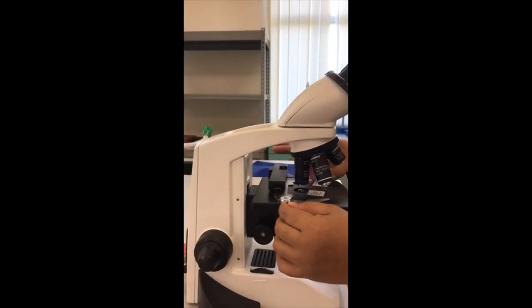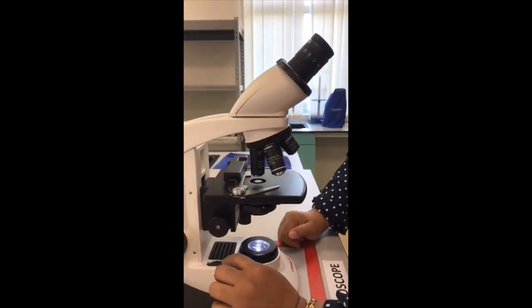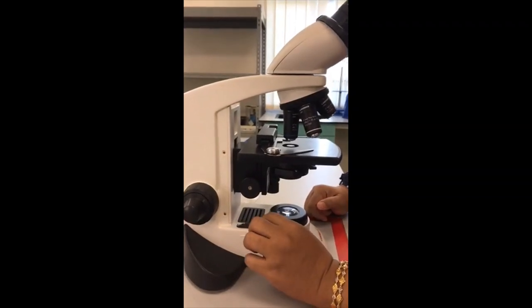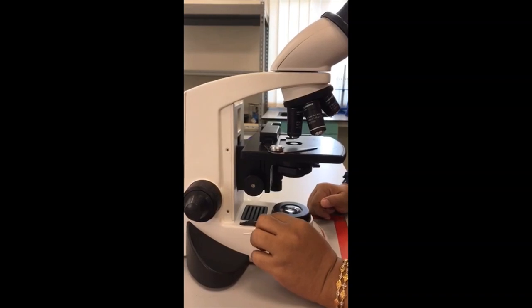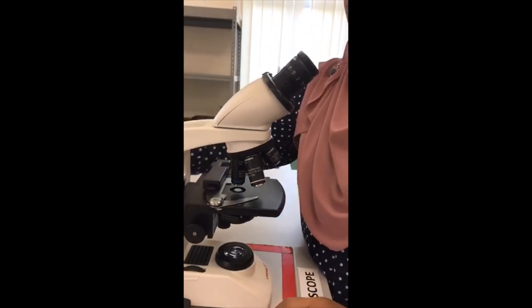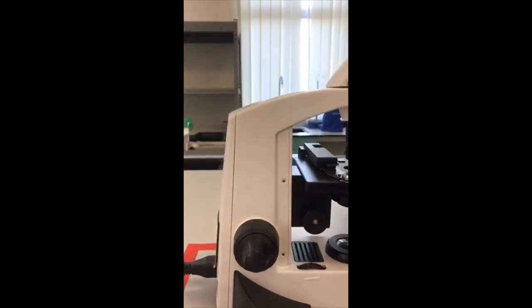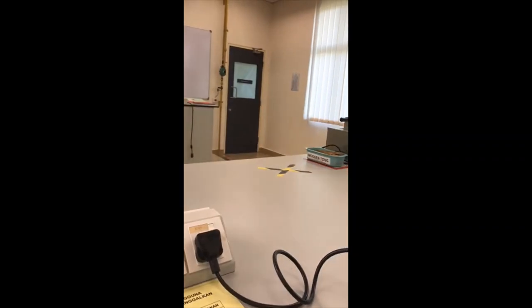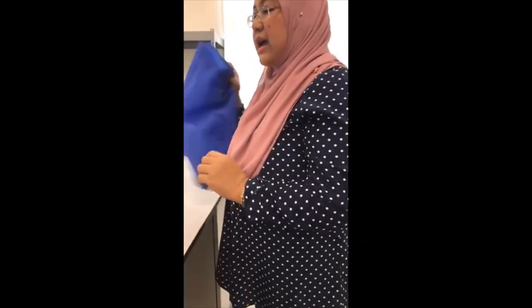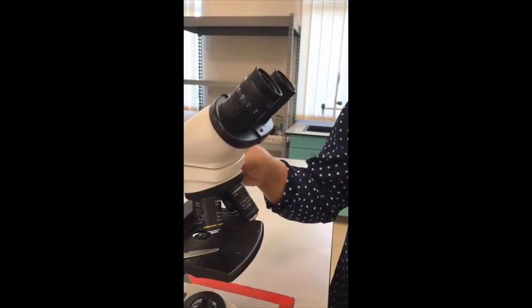Remove your specimen. Then make sure the light intensity knob is lowered and switch off the on/off button at the back of the light microscope and also the power source. Before leaving the lab, make sure the 4x objective lens is positioned vertically aligned with the light source.